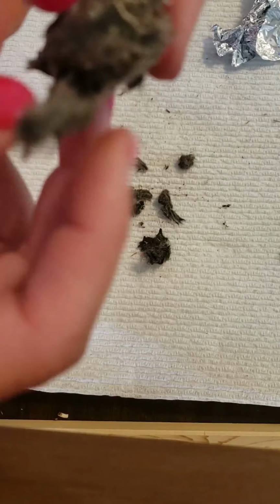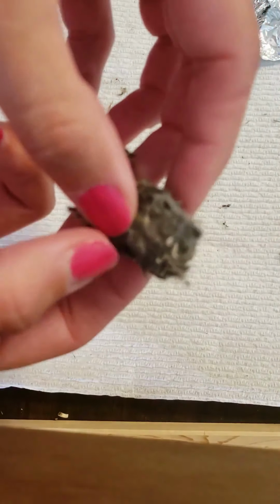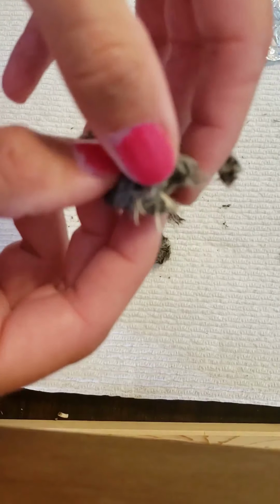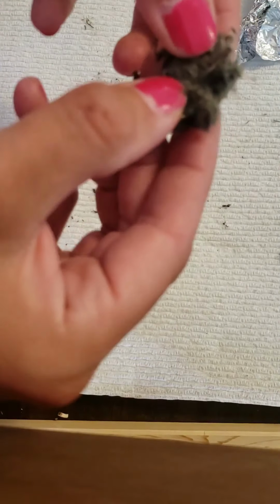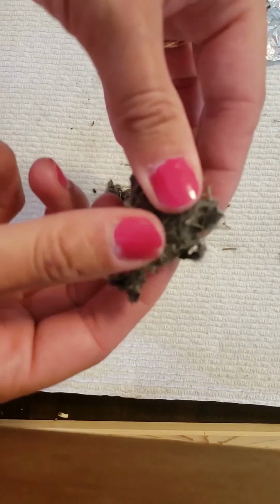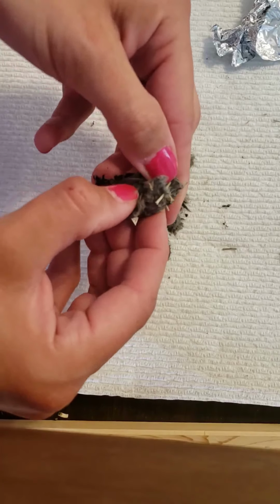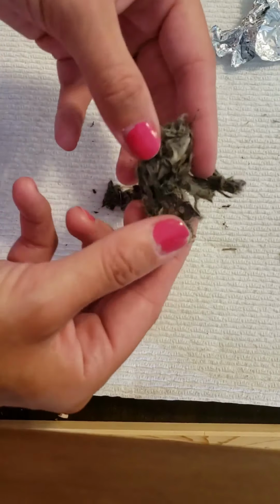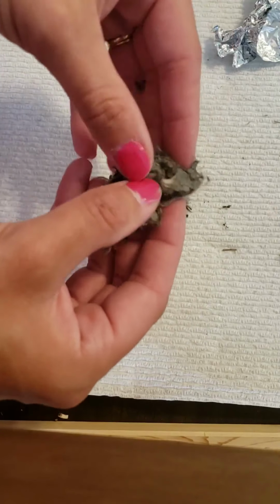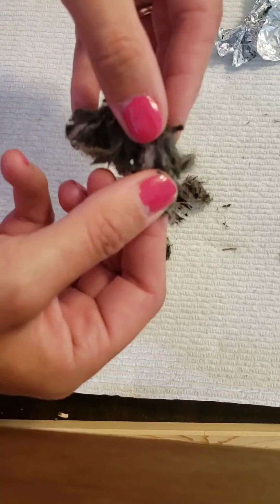And this one? I'm hoping, I feel like there's something big in this piece right here. So I'm hoping that it's another skull or something, because it's not breaking. It's very hard to break. And let's see. I think I broke this one. Oh goodness. Yeah, it's something all right. Oh my goodness. This is crazy.